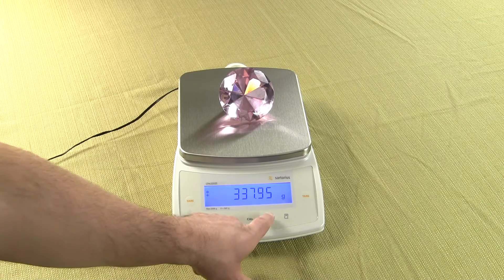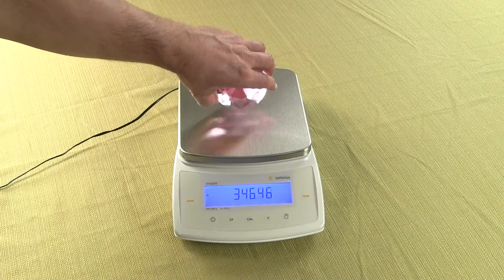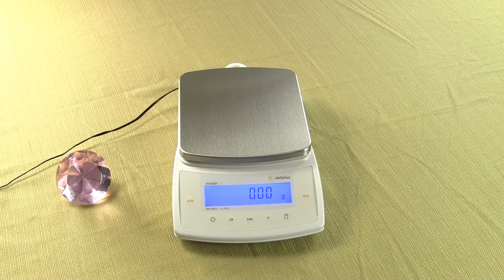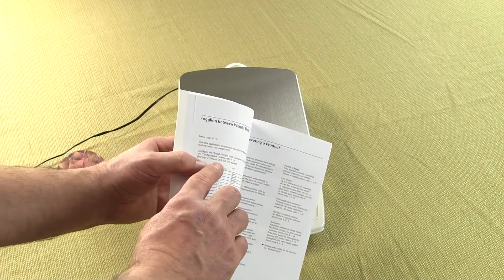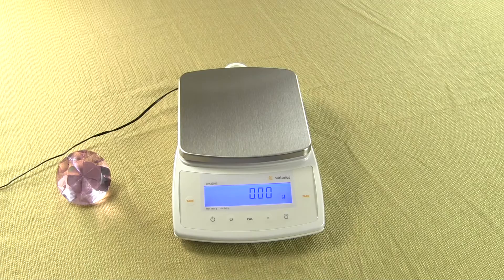But it's not going to work. Press the F key — we have nothing. This is a common error; we get a lot of phone calls about this, and this is why we made this video. What you need to do is also set up the application. In the user manual, the application code is 2, 1, 2. So we need to set up that application.